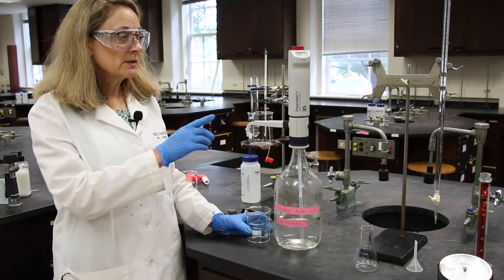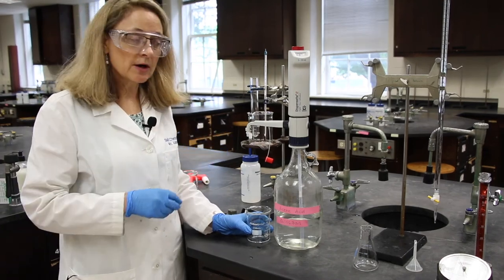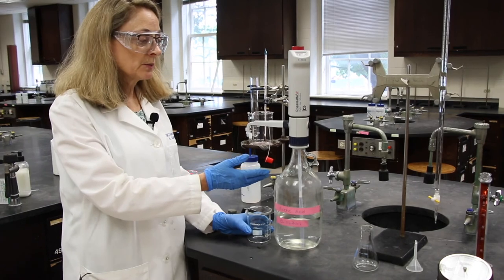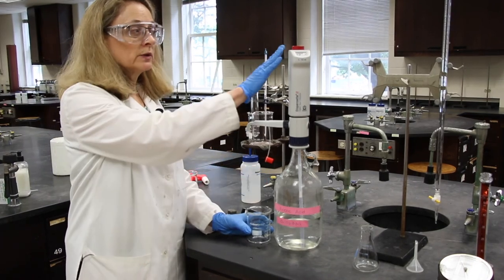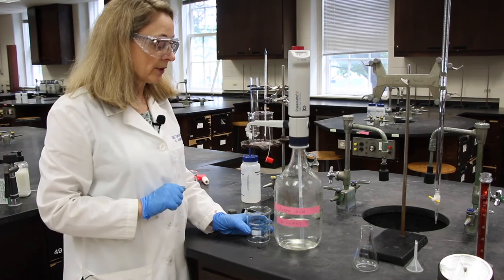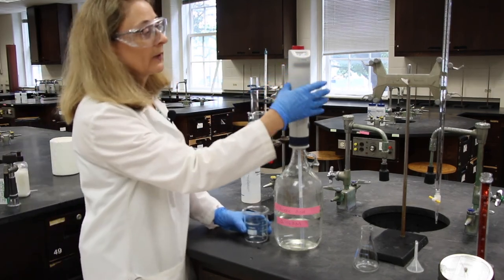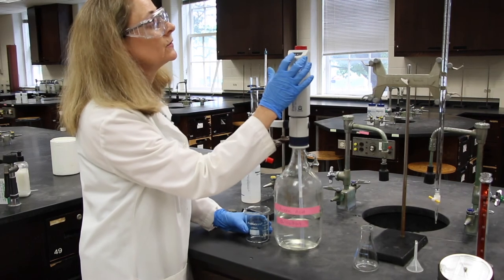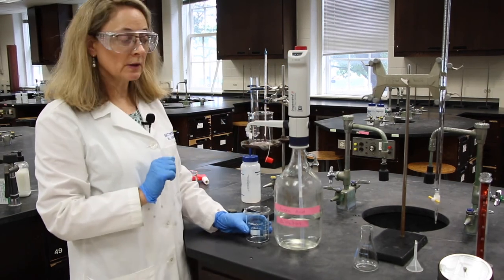The last piece of equipment that we'll be introducing today is the auto-dispenser. This is very similar to the pipette where it will deliver a specific volume of solution for you. To do this, I've calibrated this one to deliver 50.0 milliliters.